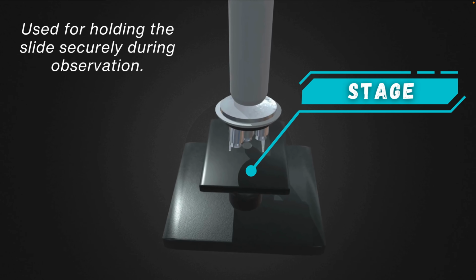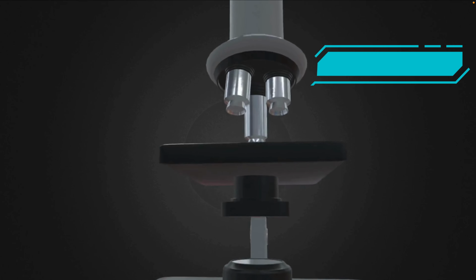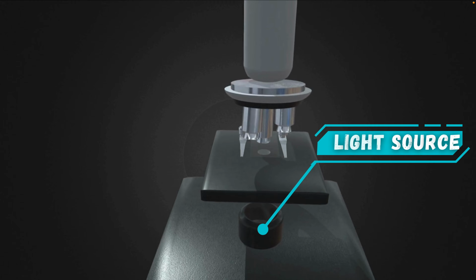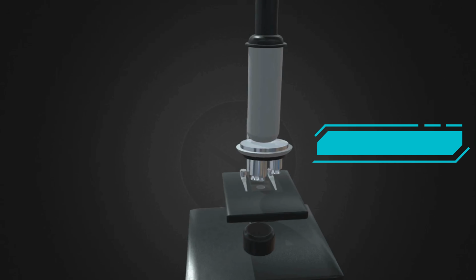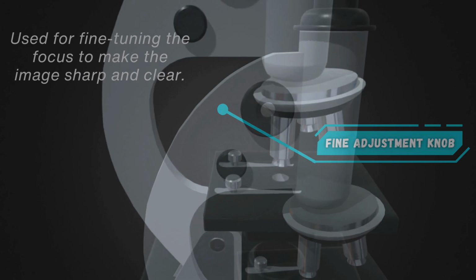The stage holds the slide. Clips keep it steady, while knobs allow precise movement to focus on specific areas. The diaphragm controls how much light passes through the specimen. The light source below provides illumination. Then the coarse adjustment knob moves the stage up and down quickly for general focus, while the fine adjustment knob fine-tunes the image.